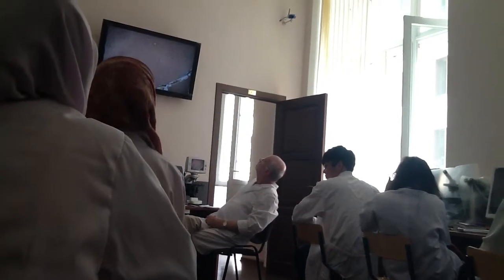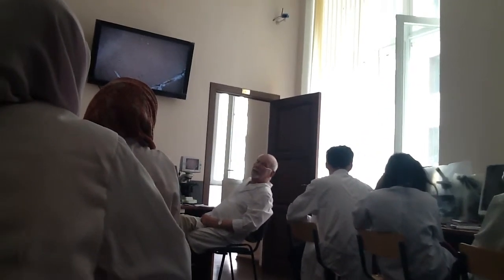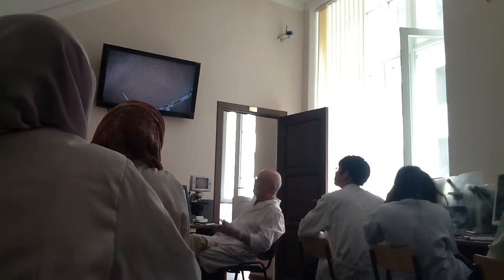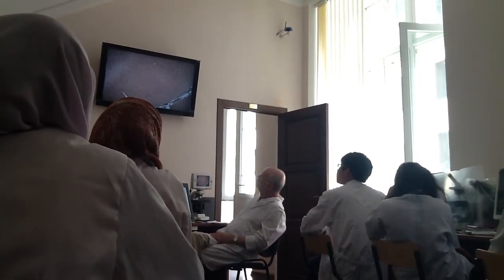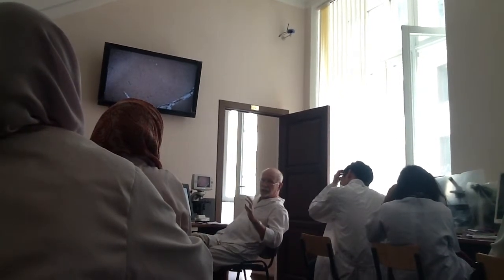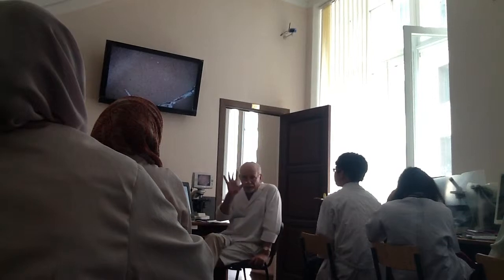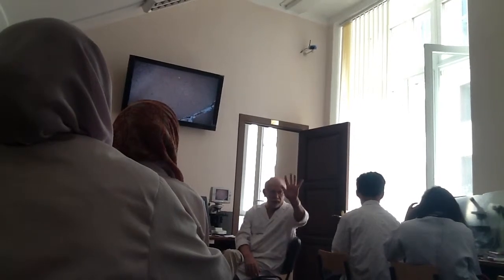Then move this slide and find the biggest neurons, visible and distinguishable at the lowest magnification. Large neuron, large neuron, large neuron. So you see the neurons, not numerous, but present here, and these largest, biggest neurons are situated in the fifth layer. It's the ganglionic layer, layer 5, fifth.